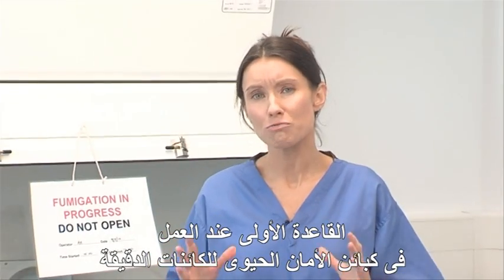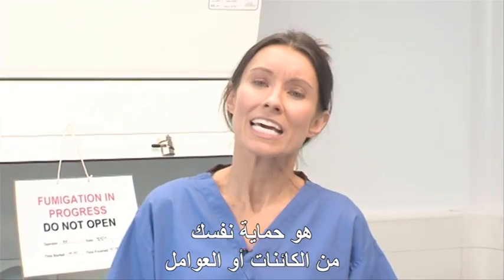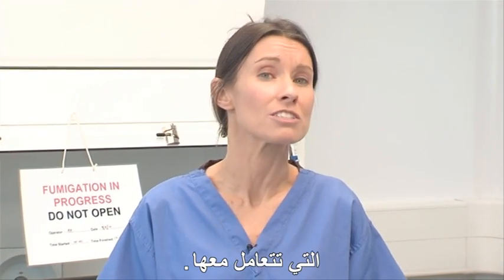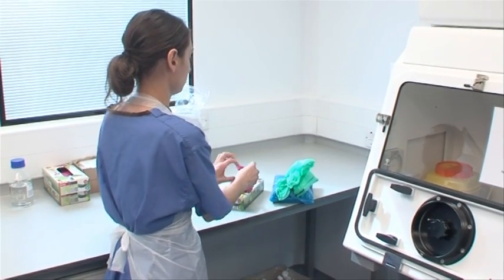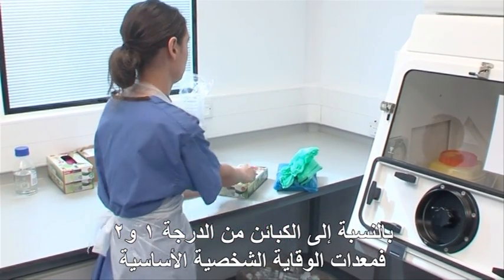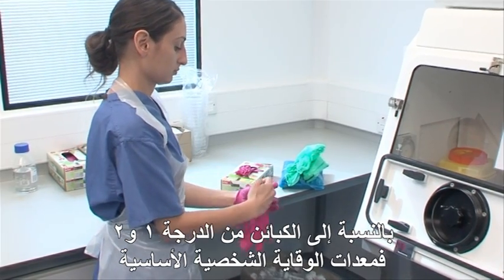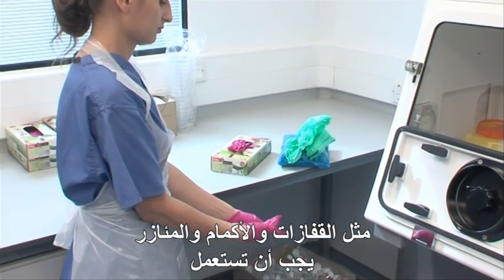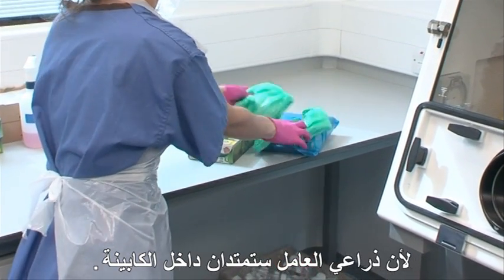The first rule when working with microbiological safety cabinets is to protect yourself from the organism or agent that you're working with. For class 1 and 2 cabinets, basic personal protective equipment such as gloves, sleeves and aprons should be used, as the operator's arms will be extended into the cabinet.